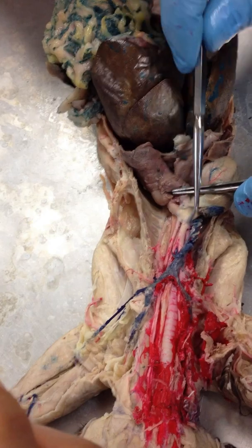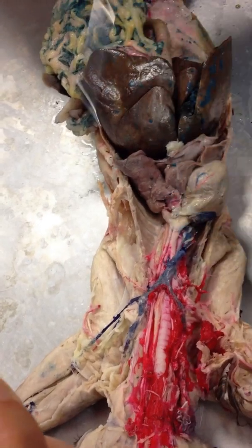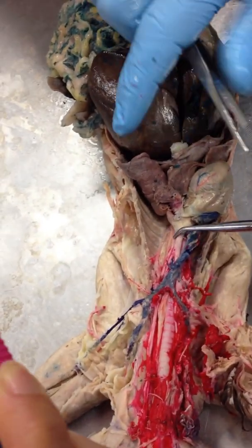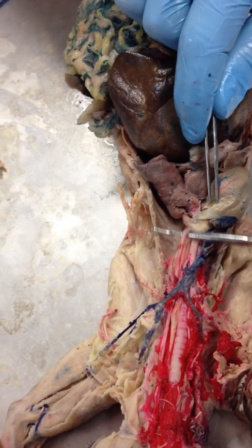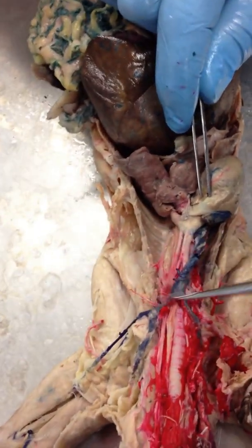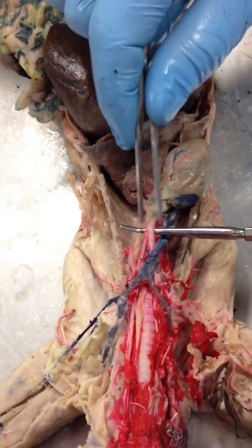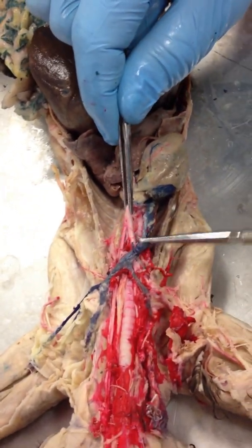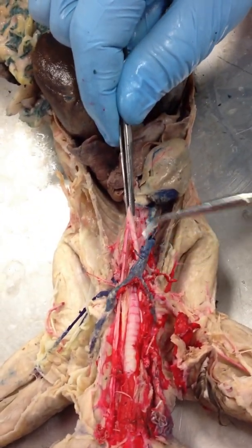Coming off the aortic arch, you have two vessels. You have the left subclavian artery that continues up, and you have the brachiocephalic artery. The brachiocephalic artery branches into three branches.